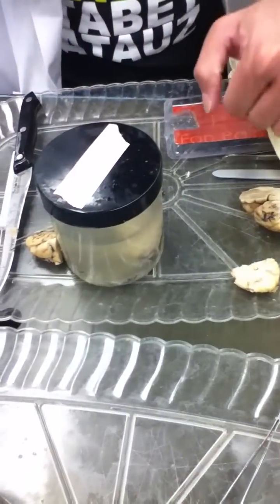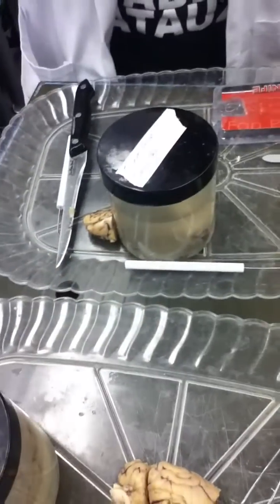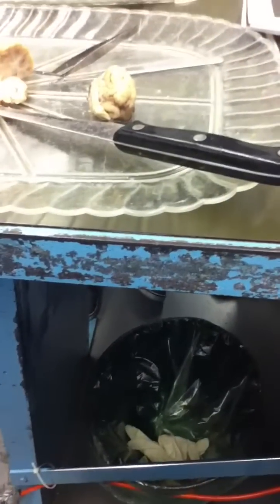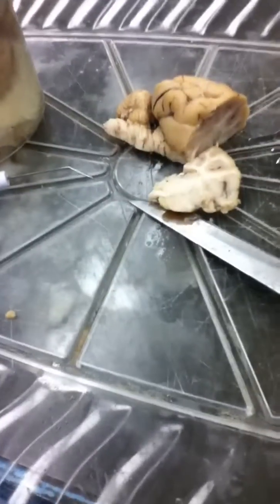The one underneath you said is the fornix, and then that leads to that dot you said was the fornix? Yeah, the fornix is an arch. Remember, my elbow is the hippocampus. The fornix kind of goes out rostrally, like that, and it gets kind of bisected over there, and then one branch goes back down. If you cut right there, you will see it twice. Right? Yeah. So that's why. Thank you.